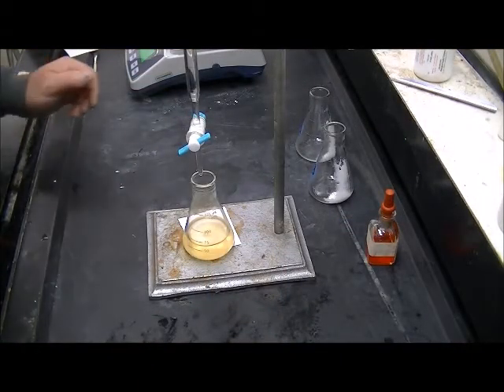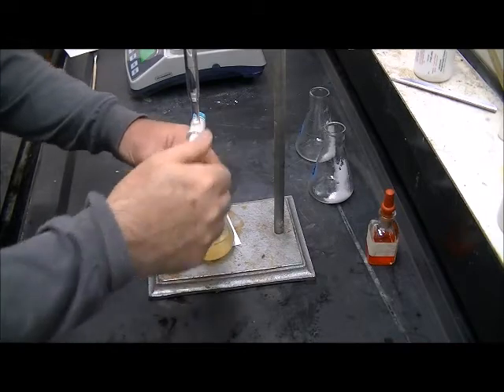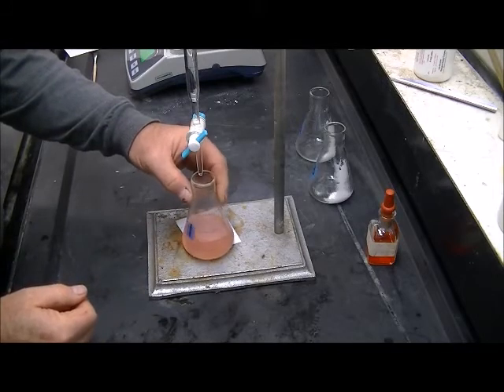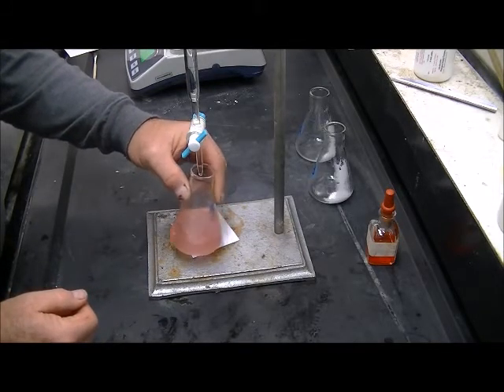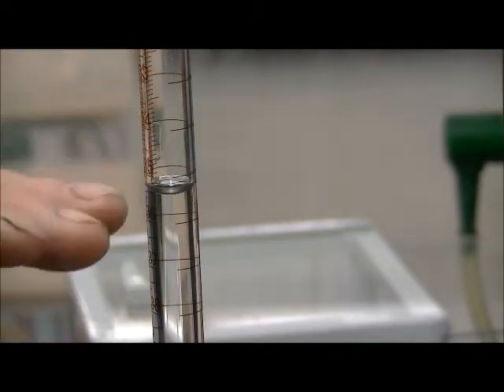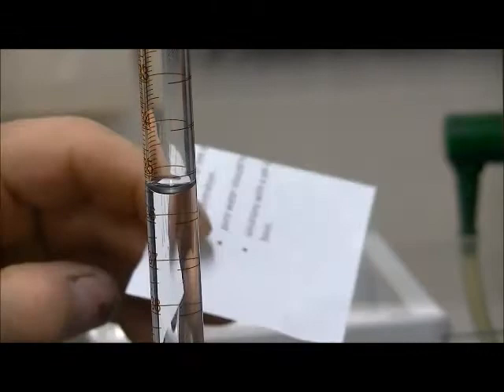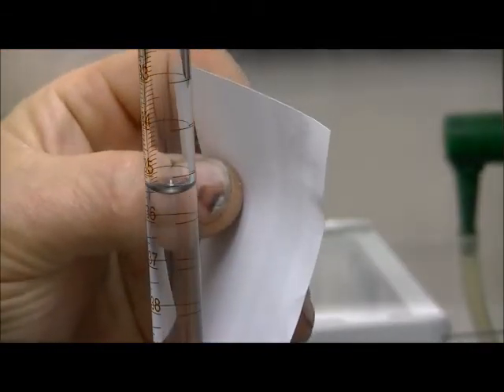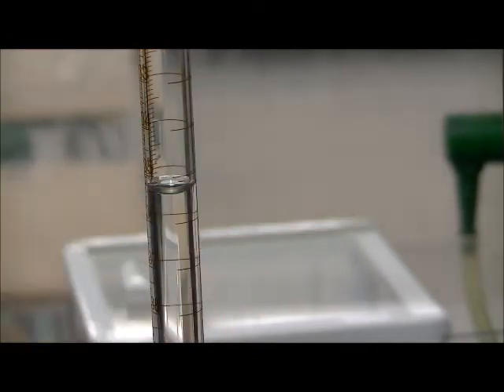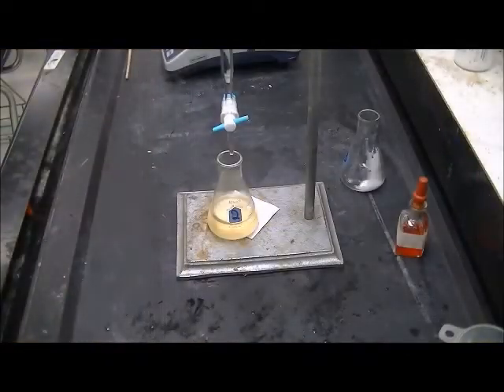Unknown C, sample 1. The camera is a little bit high for this one. You should always have your eyes level with the line where you're reading. So I'm down a little lower here. And I'm seeing 35.4 milliliters looking straight across the meniscus. 35.4.